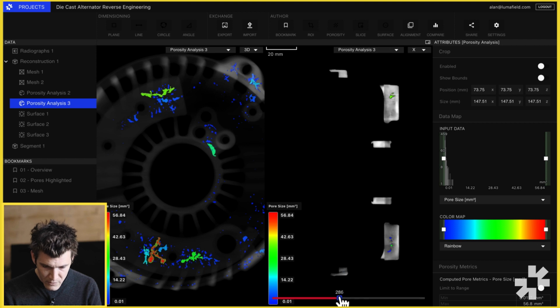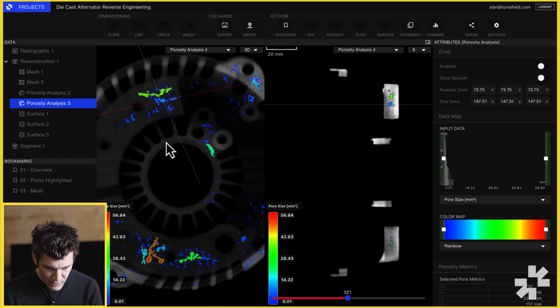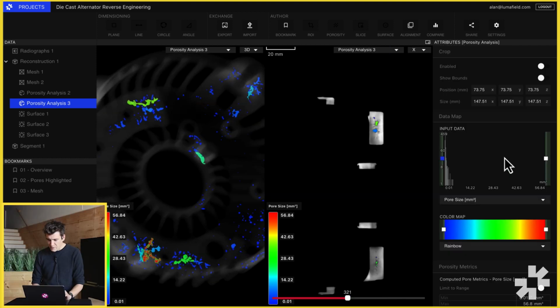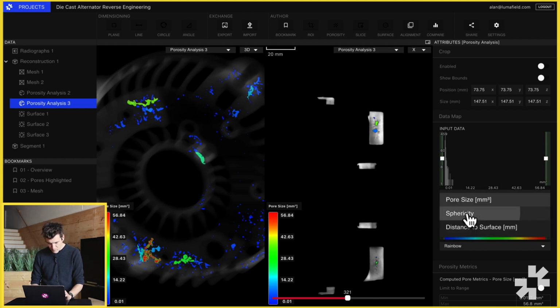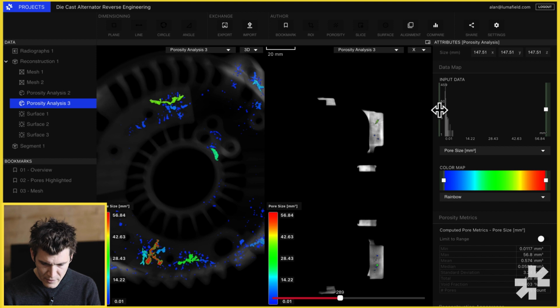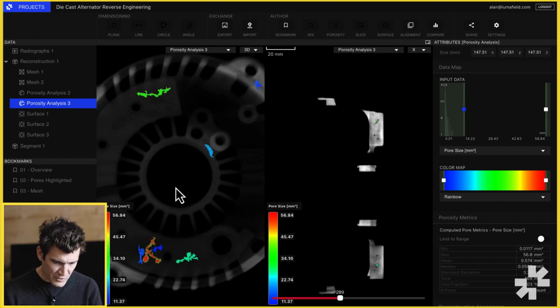You can scrub through and see individual pores highlighted here on the right, and if you select an individual pore, you can see where that pore is in the 3D part as well as in the 2D part, and get its individual pore metrics reported here in the porosity metrics table. The porosity range map displays the distribution of a given porosity metric. So in this case, we're looking at pore size, but we can also look at pore sphericity, as well as distance to surface. If, for example, we wanted to just select pores above 14 cubic millimeters in volume, we can slide the left threshold up and just isolate those voids, those pores here in the part.